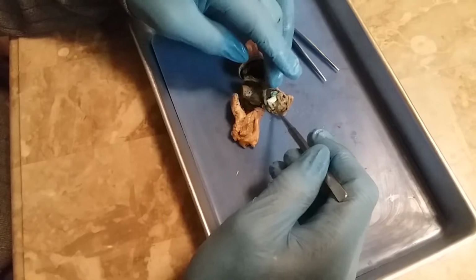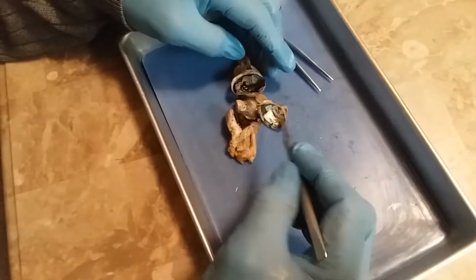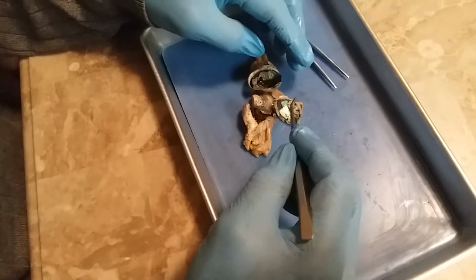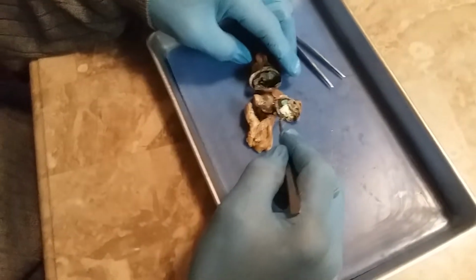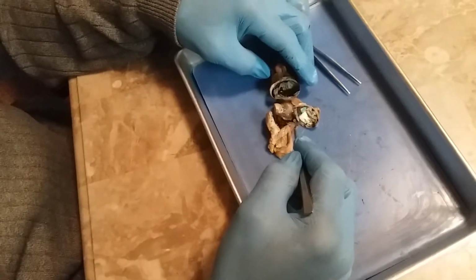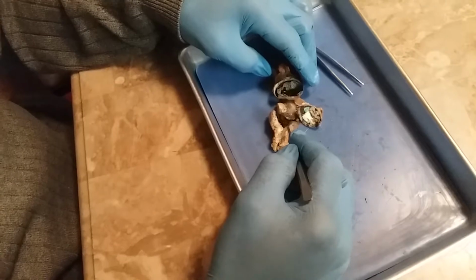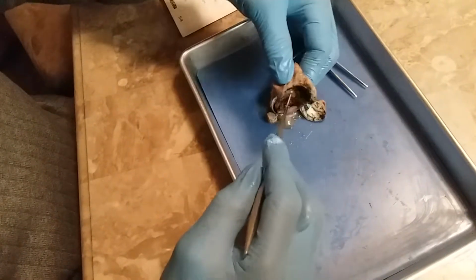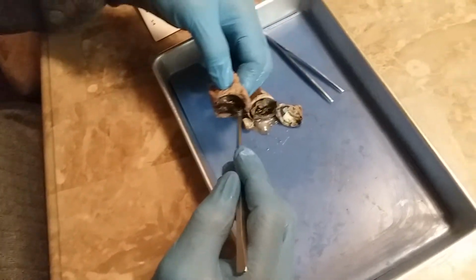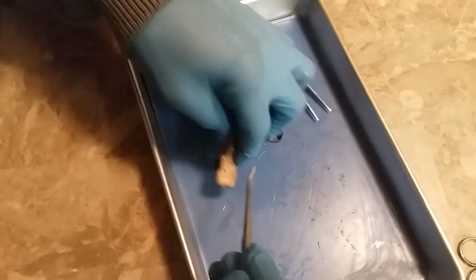The green spot that you see here is the tapetum, as we discussed where we talked about the aqueous humor, the fluid-filled area between the lens and the cornea, composed mostly of water, which helps maintain the shape of the eyeball. So the blind spot is right here. As you're looking in here, you can easily see it, and it connects with the receptors of the optic nerve.